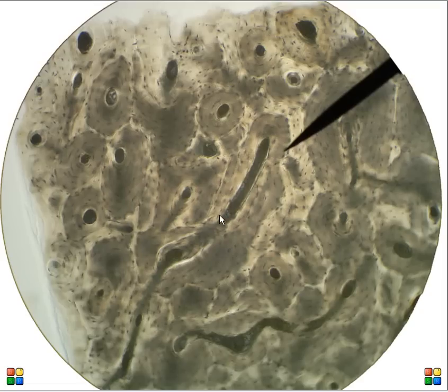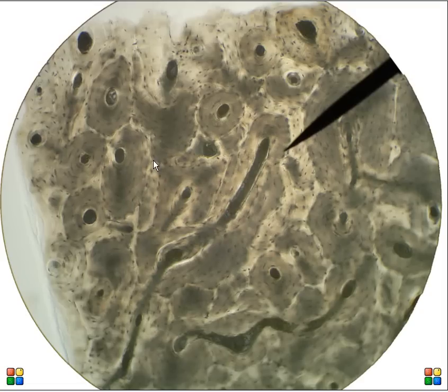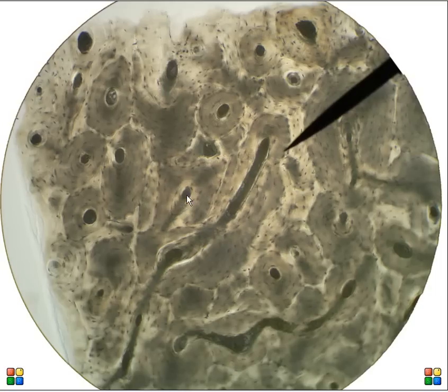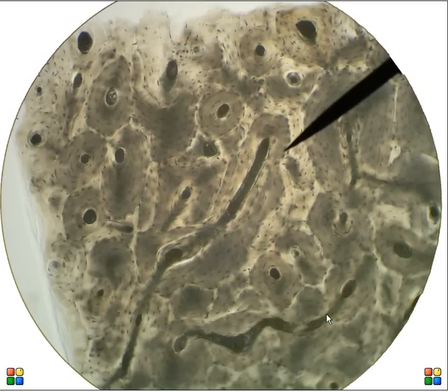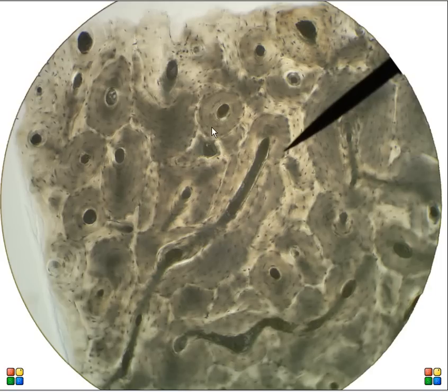Another slide showing the same basic thing. You can see perforating canals here, here's another one, and here's another one — perforating canals.